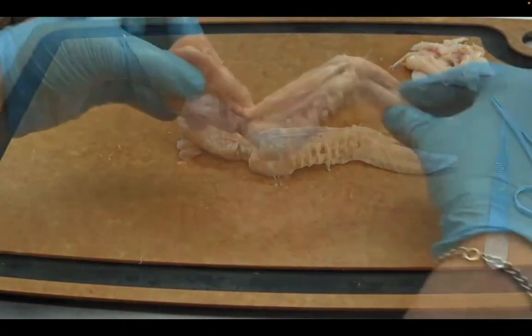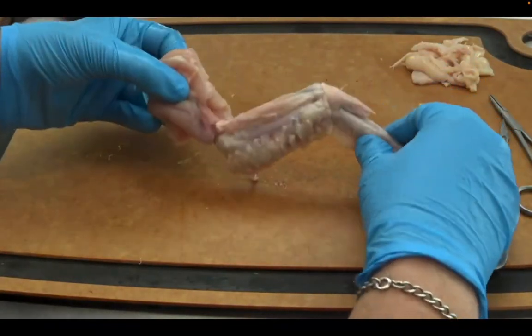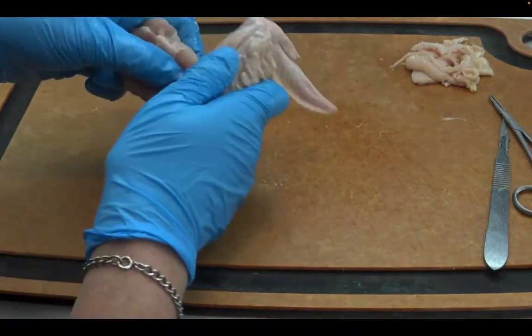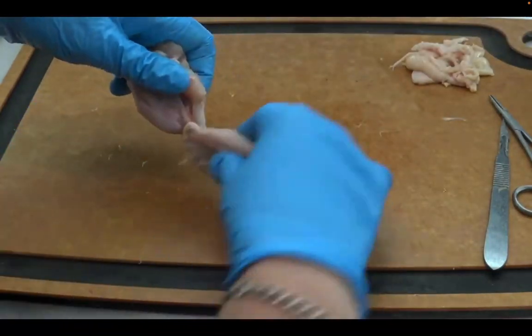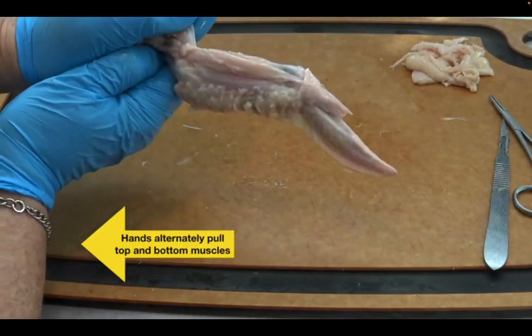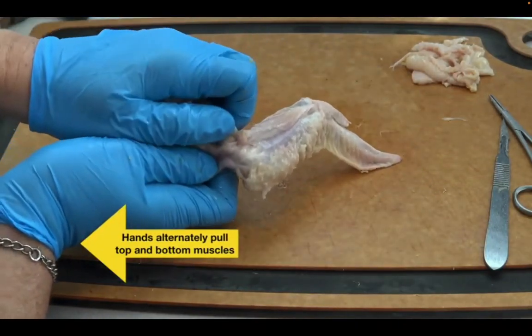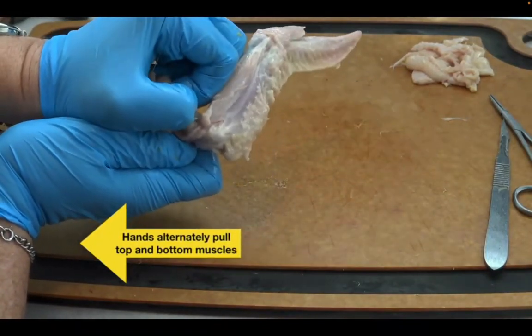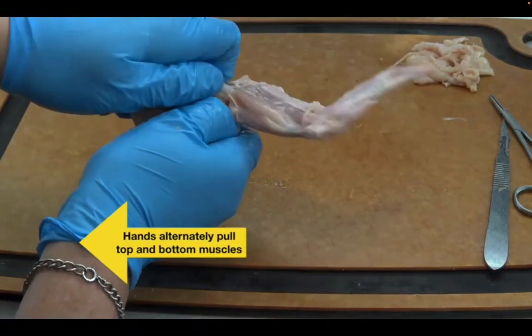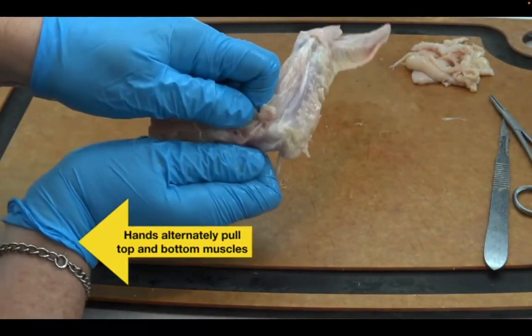Okay, so now we've got our chicken without the skin. And again, it does move. But remember, we have to move the muscle to make the wing move. So he's going to do that now with the bicep and tricep. And you can see there's already some trouble doing that. So he is pulling the bicep, tricep, bicep. And I think you can tell very quickly that this chicken wing is not moving like it should be, as when we saw it when the wing was not broken. That wing's just going all over the place. It's not even staying the way it's supposed to. So obviously that bone had something to do with keeping this motion going the way it should have.